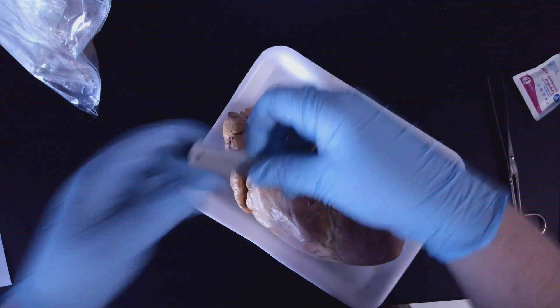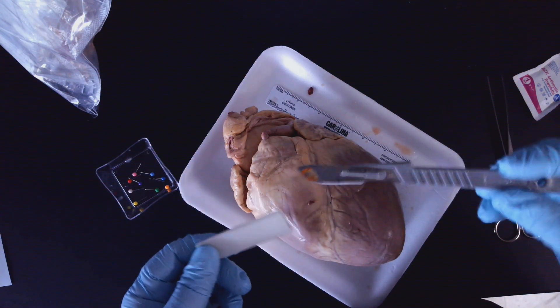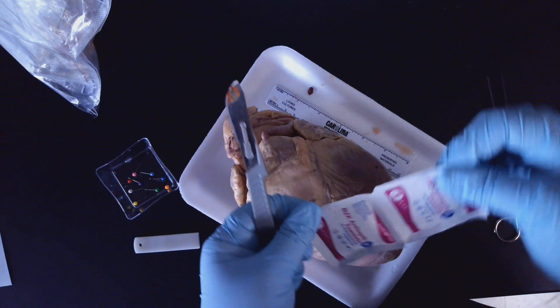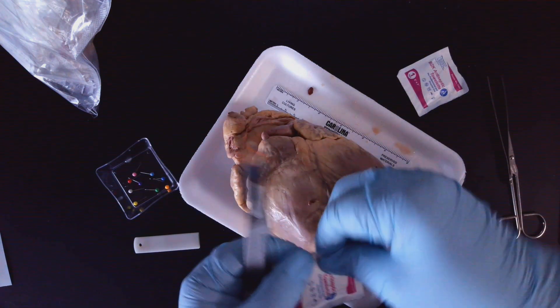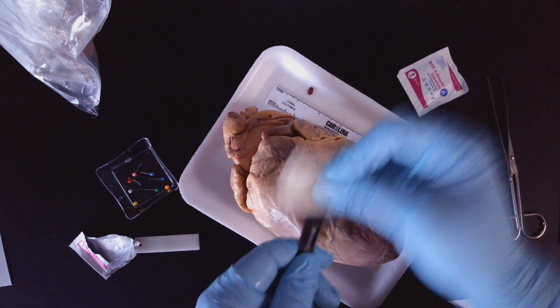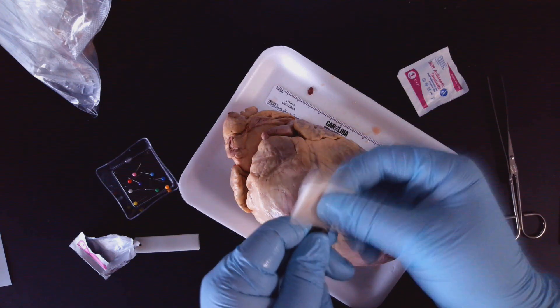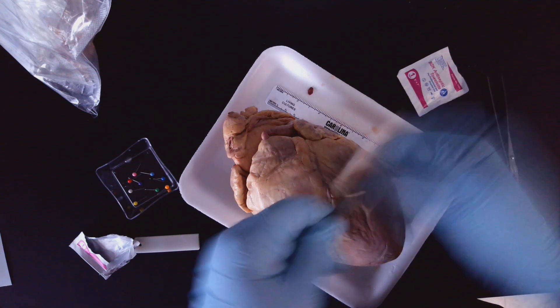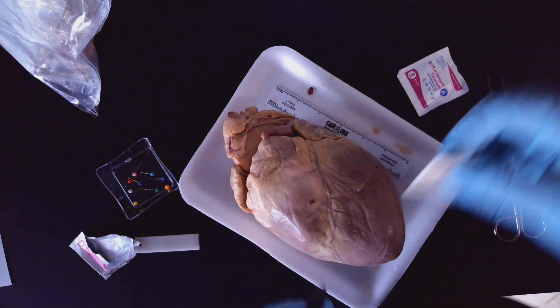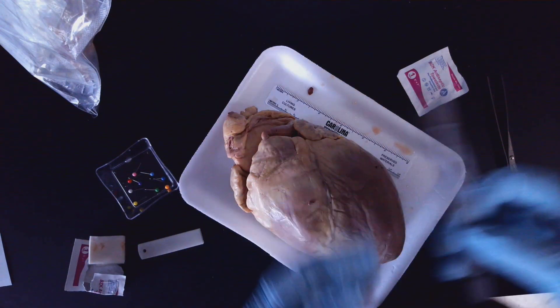All right, here's where we're moving on to this. So we're going to take the scalpel. Be very careful. This one is a little bit rusty, which can happen — it just means that the person didn't dry it very well. So I'm just going to take one of the wipes that I have and just wipe it off a little bit. I'm not worrying about getting super clean. So if that happens to you, that's fine. I may have to swap it out. We'll see how it works.